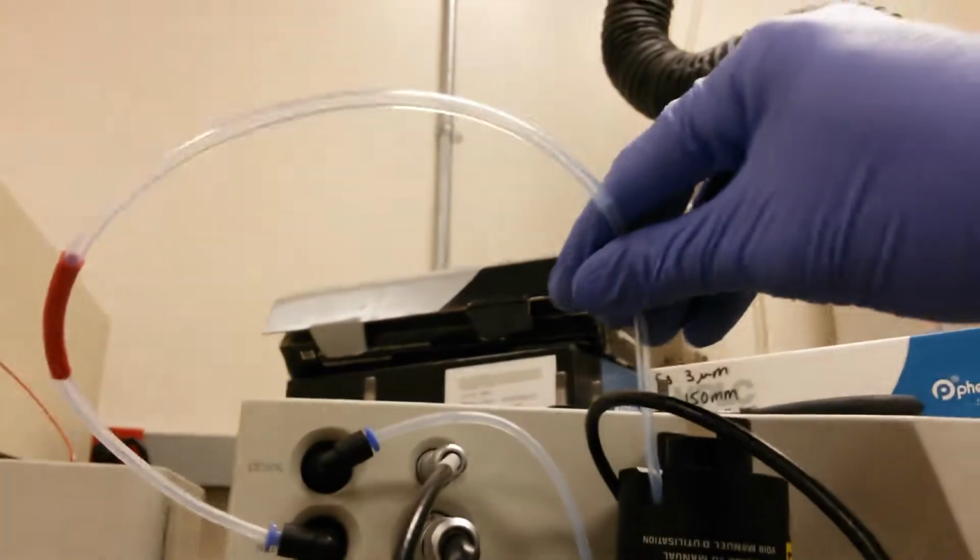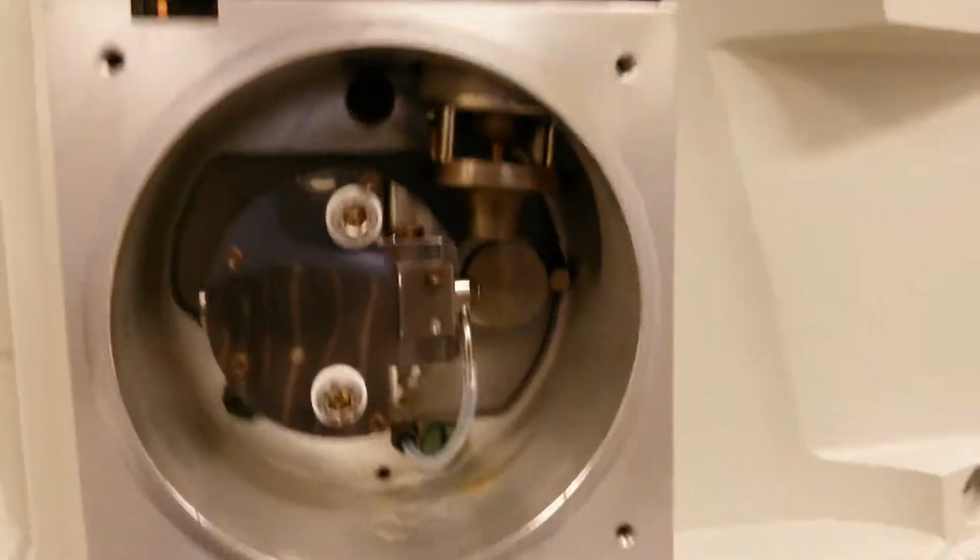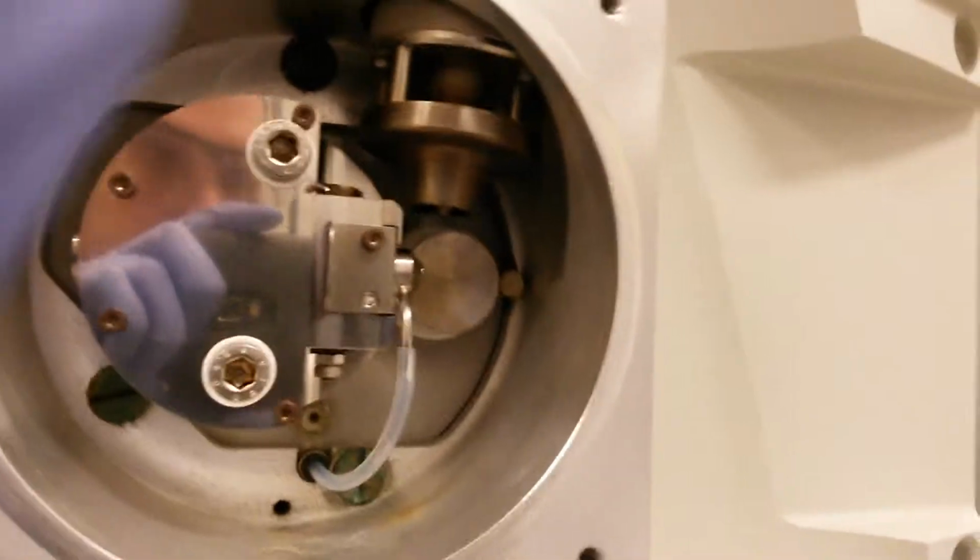And the pressure in this line that comes in at the top seems to be what pushed solvent backwards up through this and may have caused further problems. So hopefully that gives you some ideas and helps identify the problem.